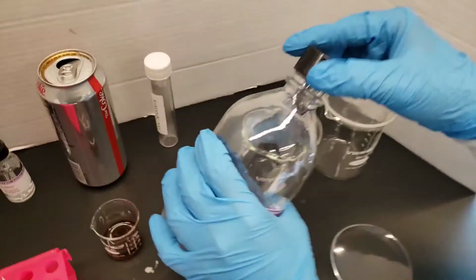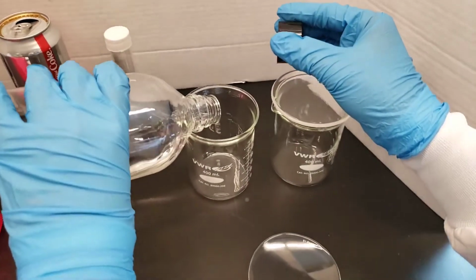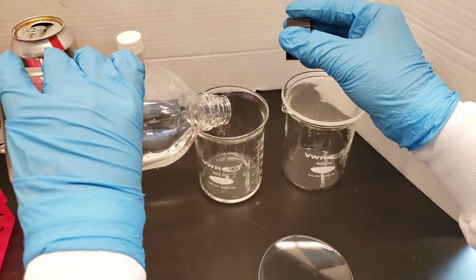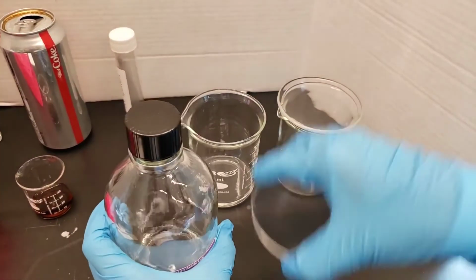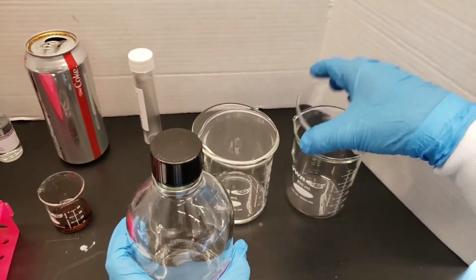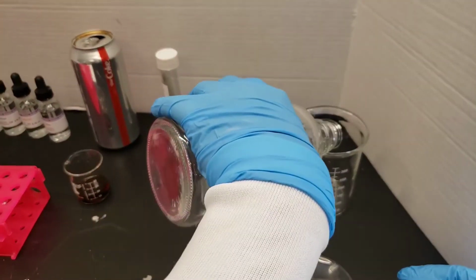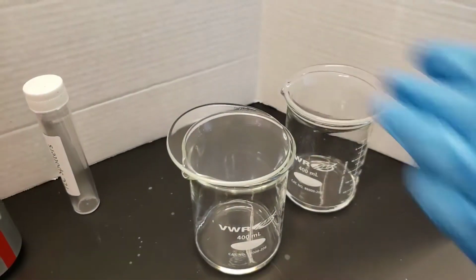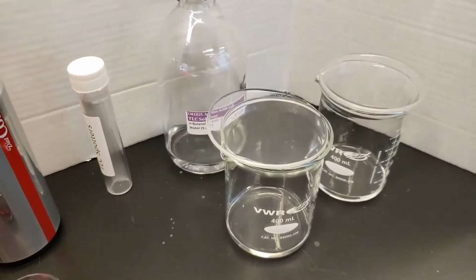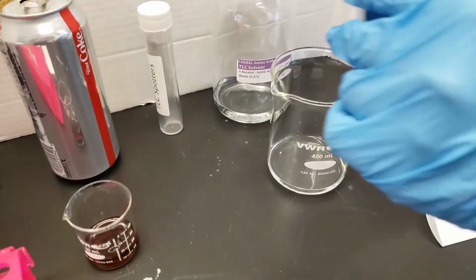Once we have our plates spotted, we can make our TLC solution beakers, or development chambers, some people call them. We're going to put a little TLC solution or solvent mixture in each beaker, maybe about 25 milliliters. We want to make sure that solvent is below the line on our plate, which is why we drew the line at 1.5 centimeters.